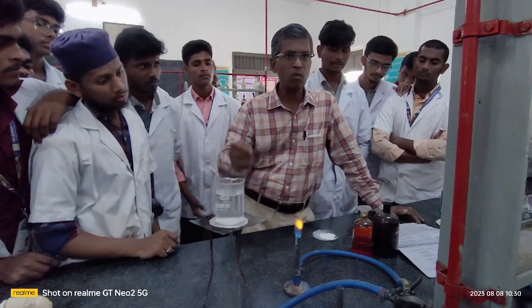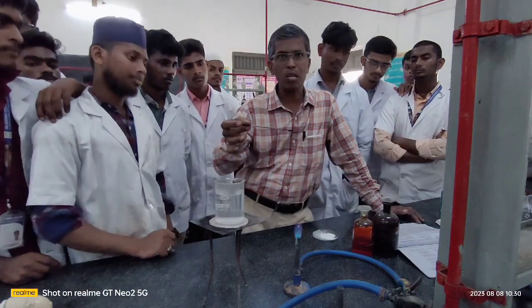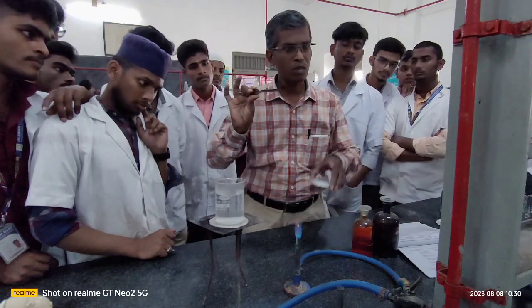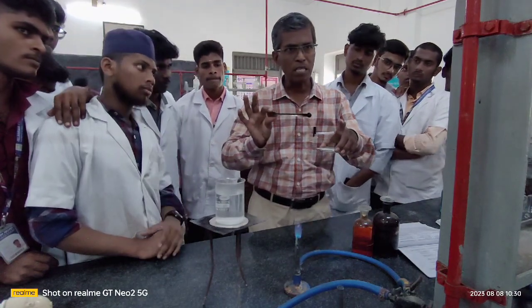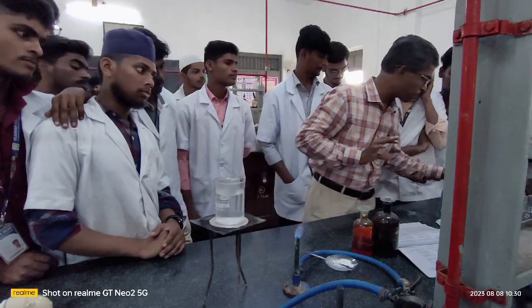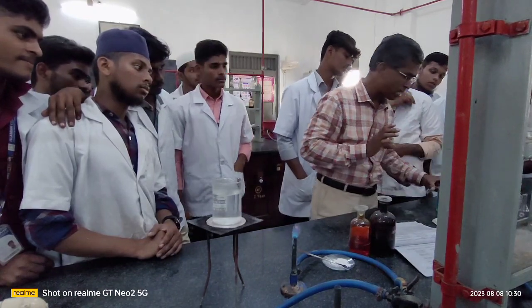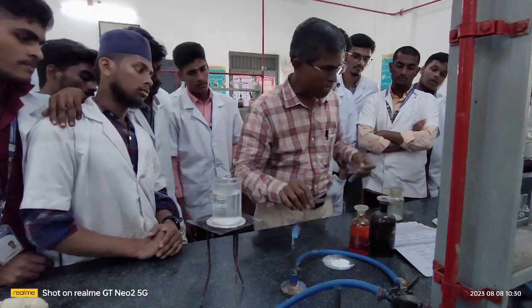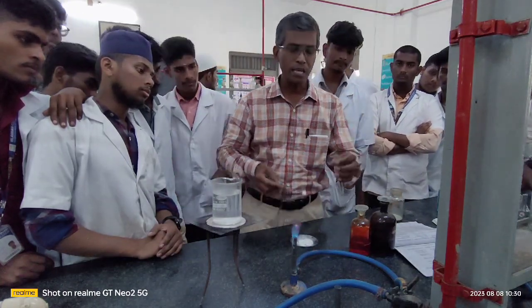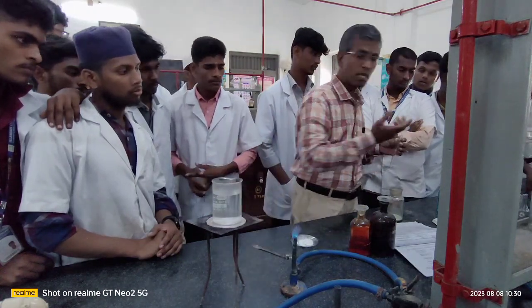Just now I finished showing how to confirm whether the given compound is aromatic or aliphatic. So with this, I am closing the demonstration on aromatic or aliphatic. Now I am moving my demonstration to show you whether the given compound is saturated or unsaturated. Take the same compound in a test tube, a little of it. Where is distilled water?